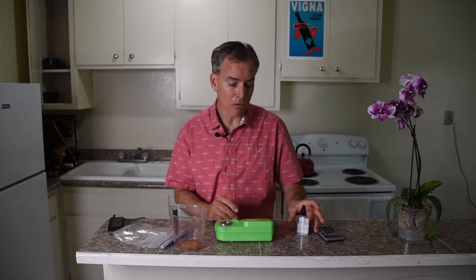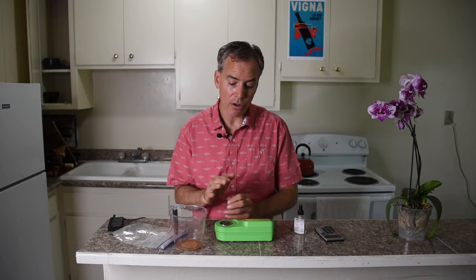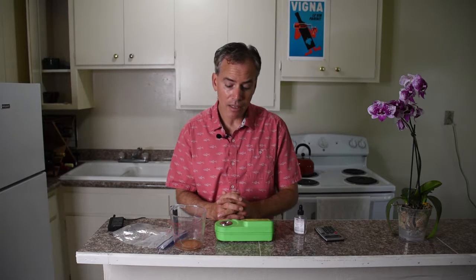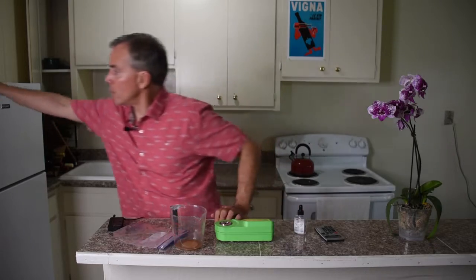Just like any other device, you want to make sure it's calibrated properly — follow your directions and make sure you're getting accurate reads. Refractometers require what's called DI water — deionized water. You can't really use regular water to measure and clean your prism, because regular water tends to have treatments on it and can leave chemical films, which can throw off your actual numbers. After you've calibrated your device, you're ready to take measurements.